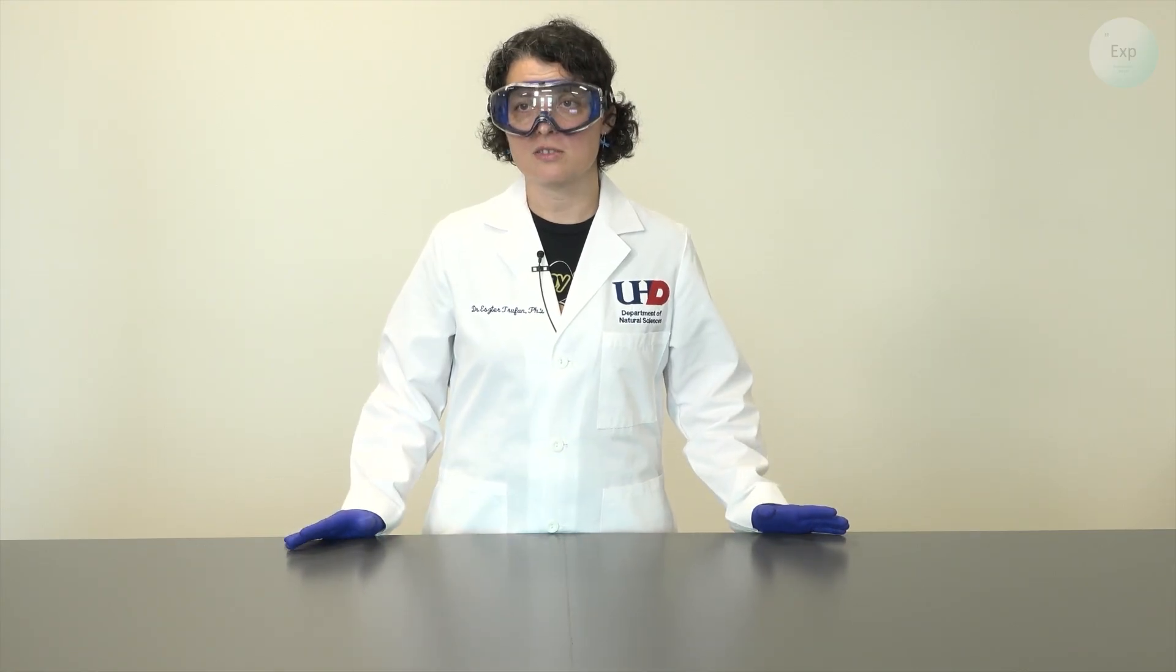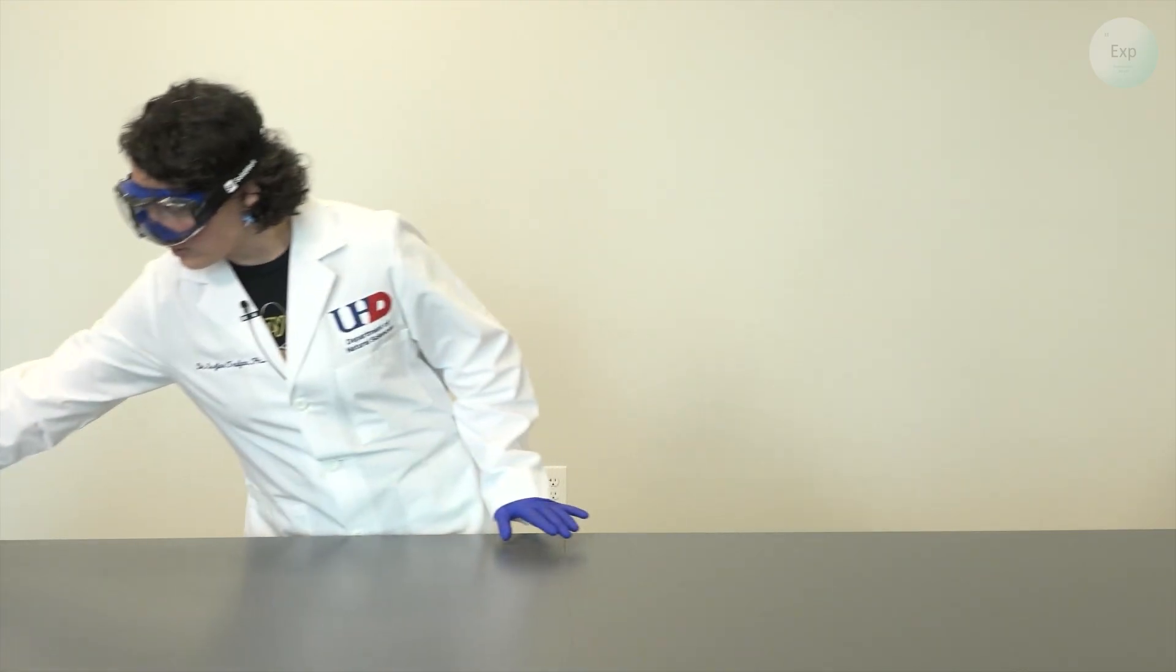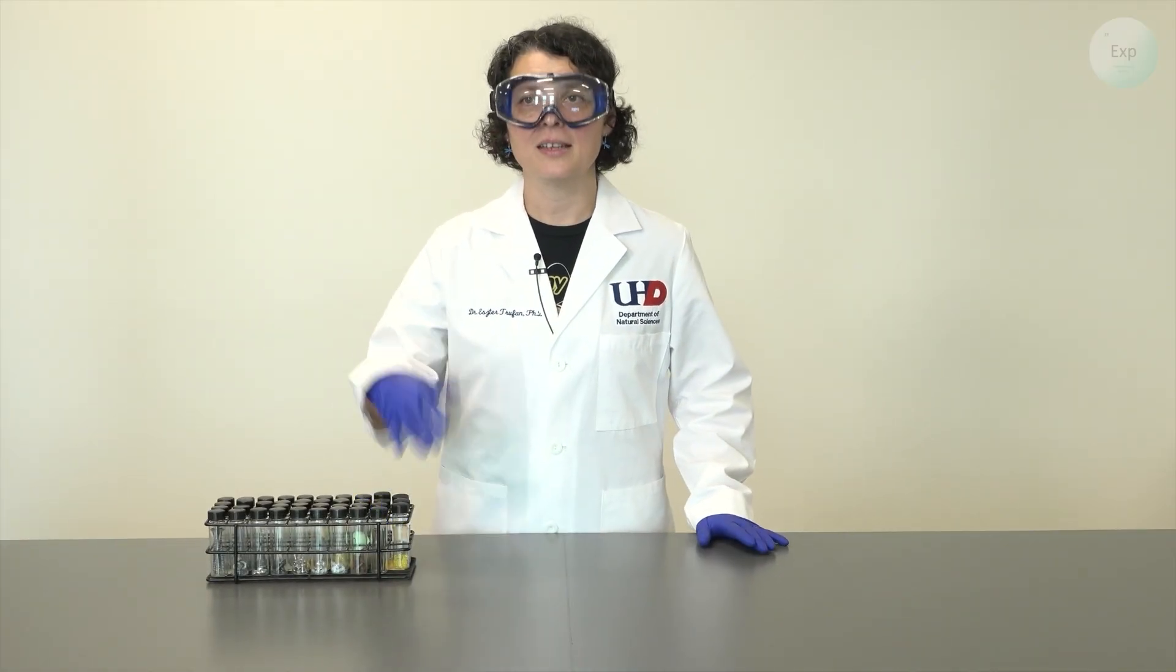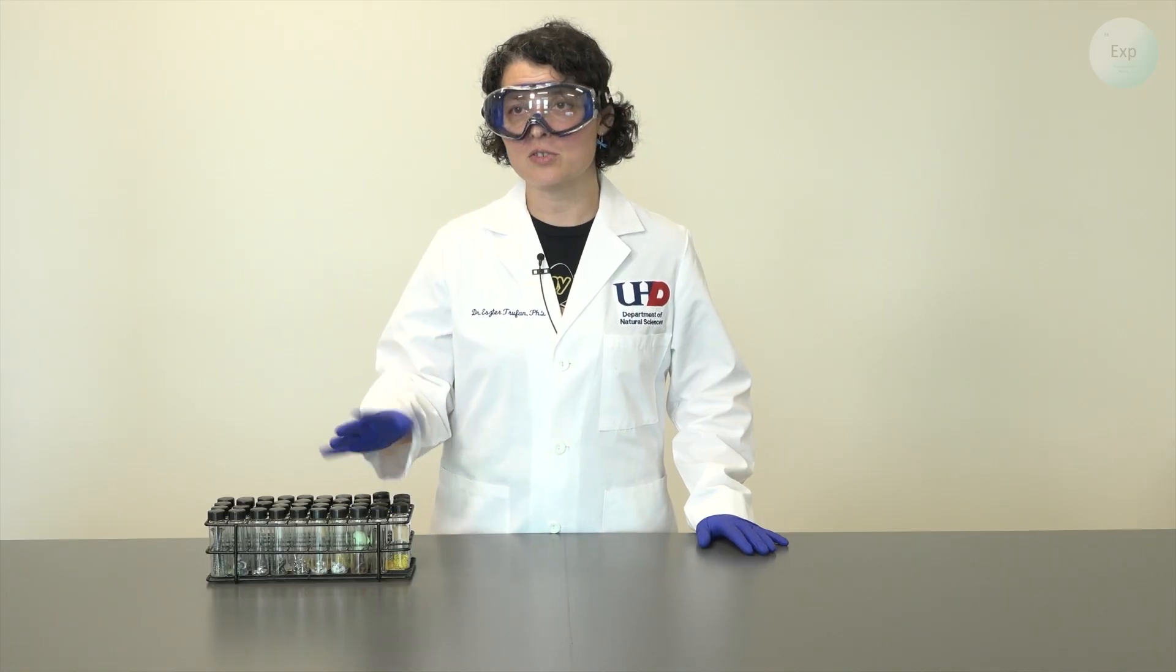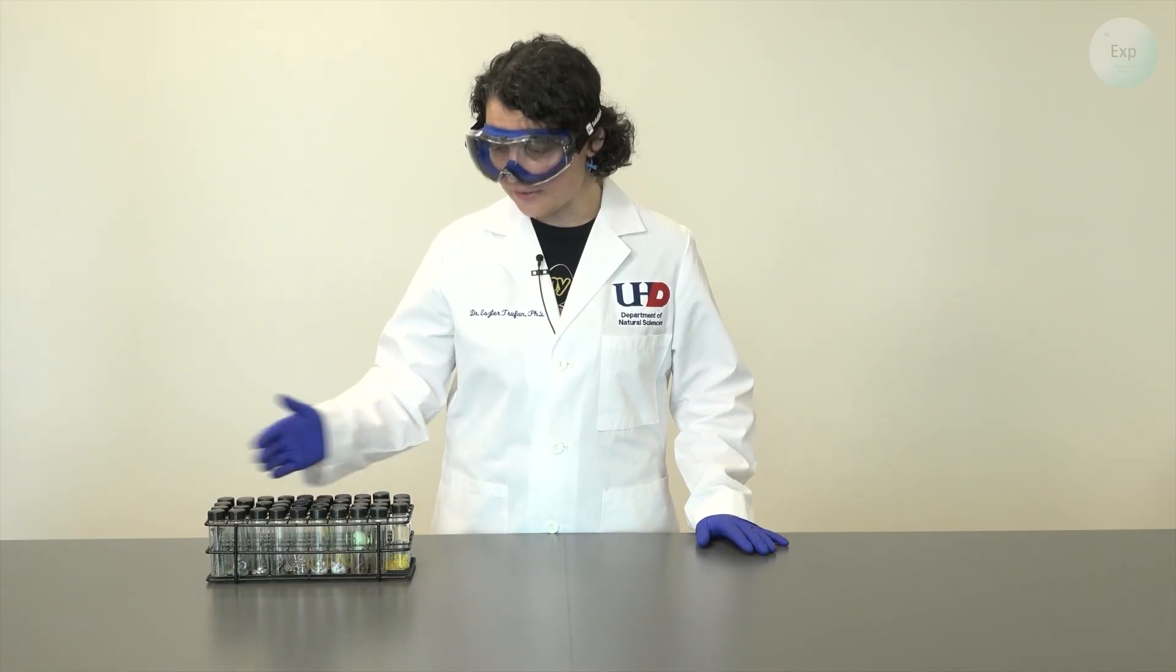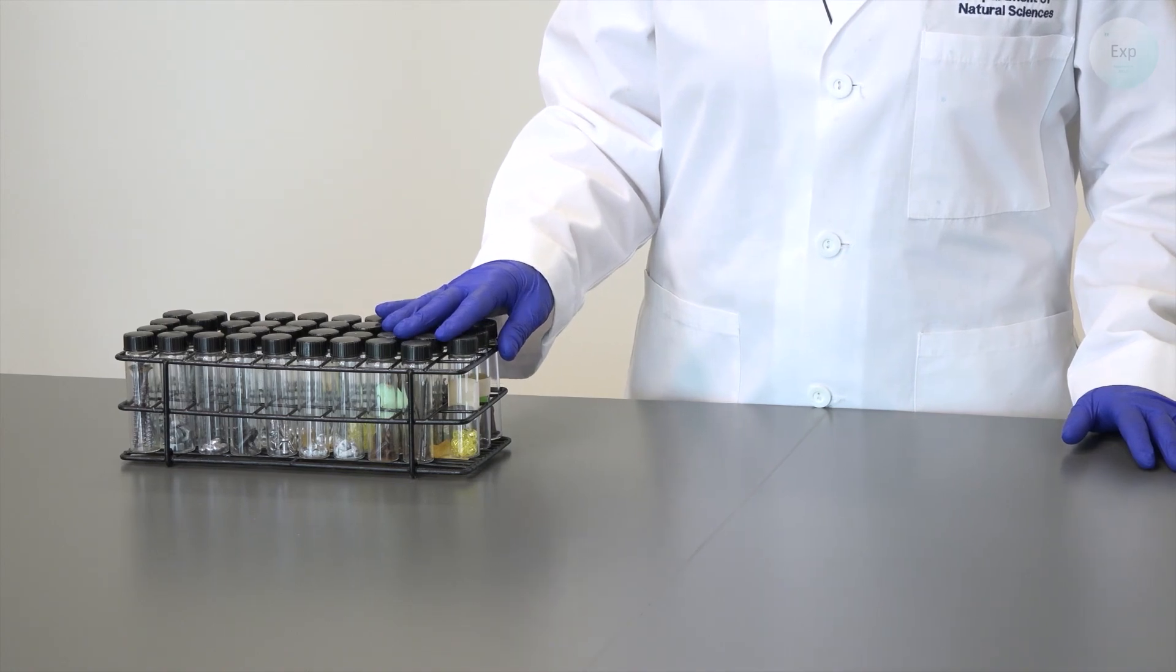Most of our solids are in this category and here is a collection of random items. We are going to select one of these and I will demonstrate what to do. You can take any of these objects and perform the same measurement on your own.